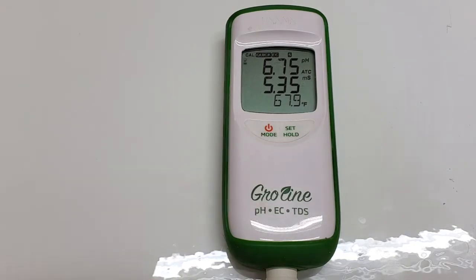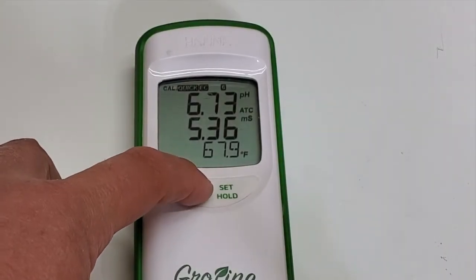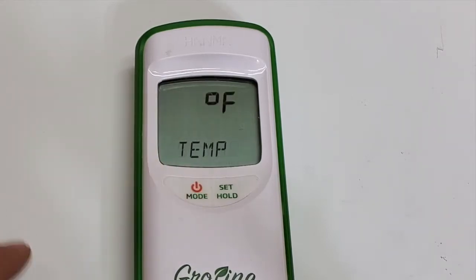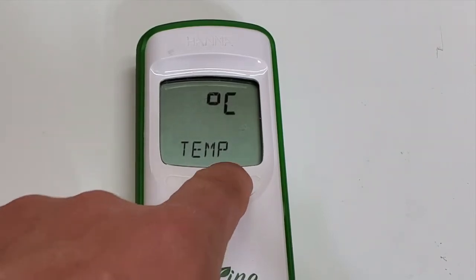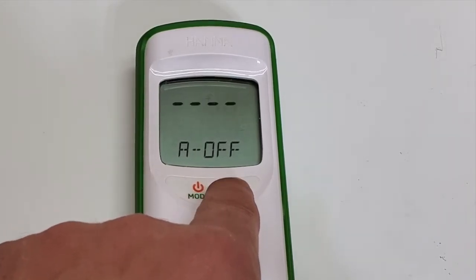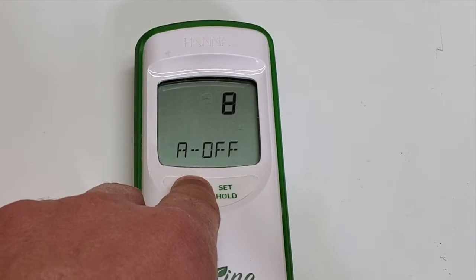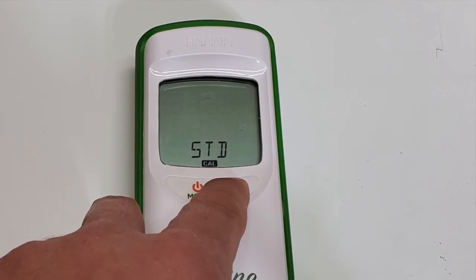This doesn't charge, so you just want to keep the battery swapped. First things first, we're going to go into this embedded menu — hold the button, it goes through quick. That's the calibration, and then the second thing is setup. Here's where you can toggle between Fahrenheit and Celsius. This is auto-off — right now it's set for eight minutes, you can go to 60 minutes, or set it to stay on all the time. We'll leave it at eight minutes so we don't kill the battery.